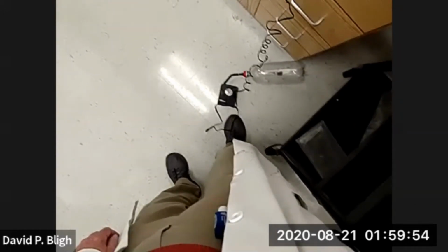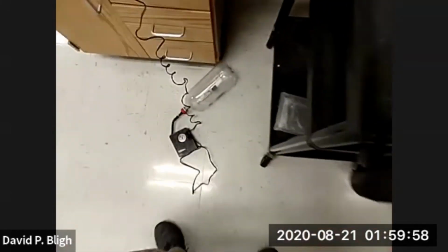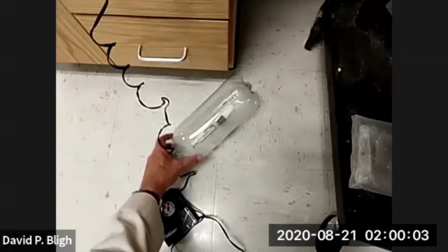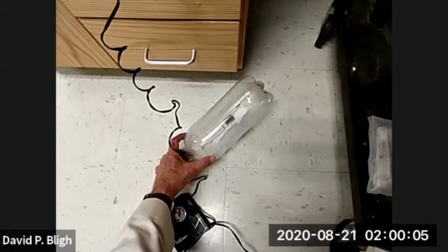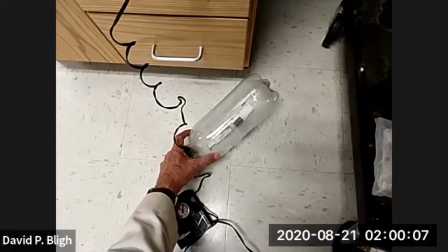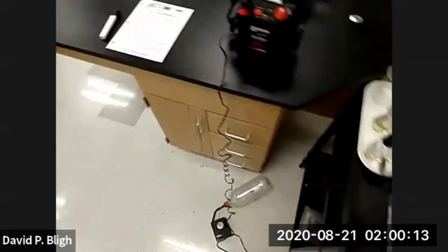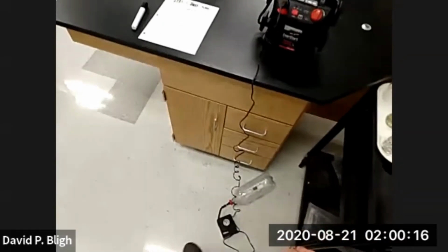Let's see, we're up to about 58 pounds, and the volume has dropped from about 10 to in the neighborhood of 5. Let's go down just a little bit more. And that's the advantage of using a system. If I detect a problem, I can always cut power from here rather than down there.